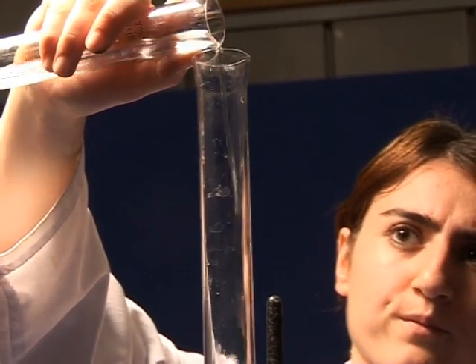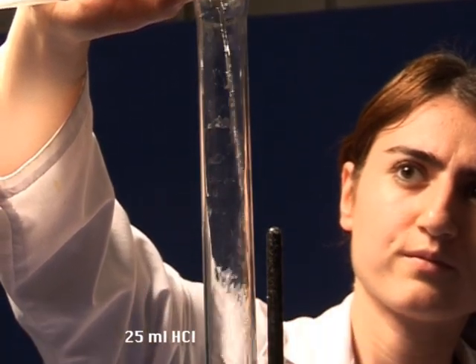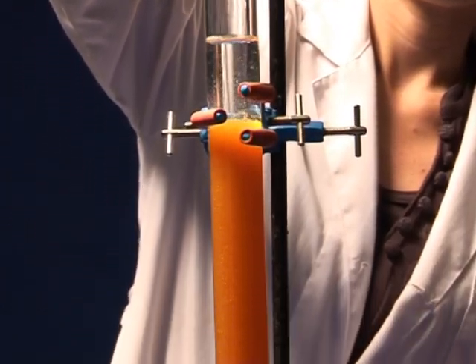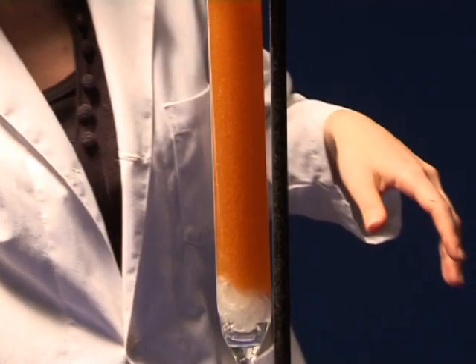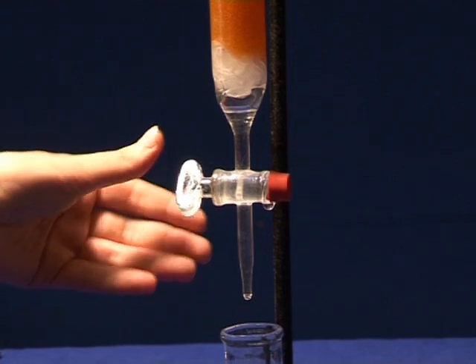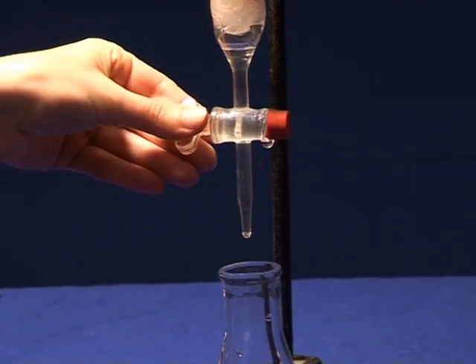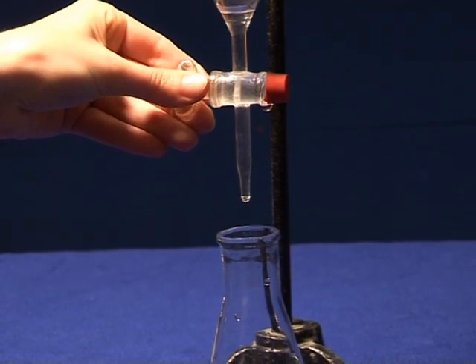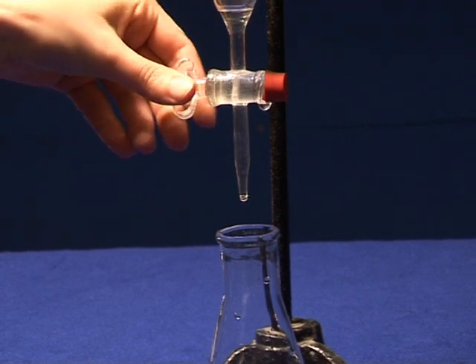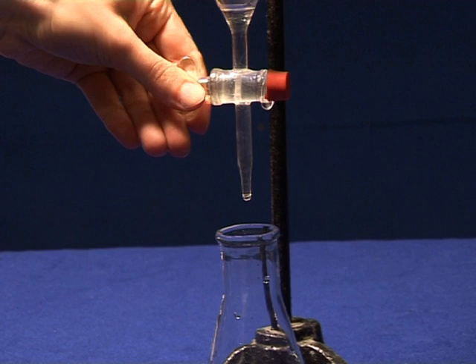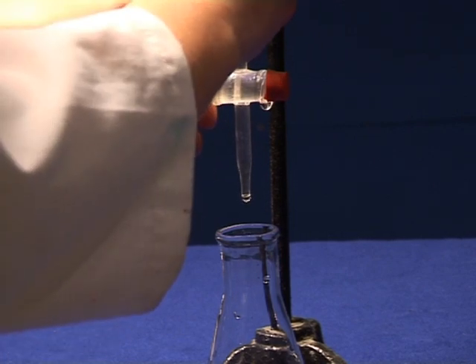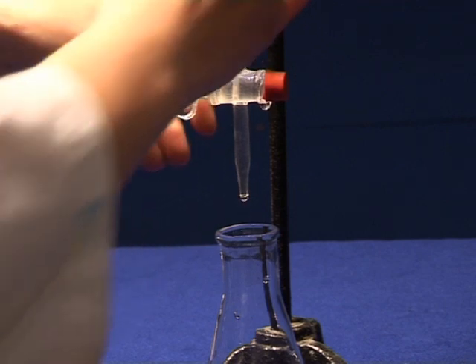Add 25 ml of hydrochloric solution into the resin column. Place a clean Erlenmeyer under the tip of the column. Loosen the clamp and allow hydrochloric solution to pass through the column. The flow of solution should not be faster than 5 ml per minute.